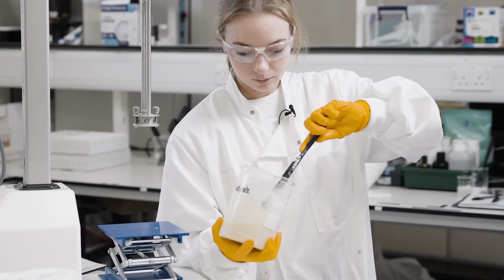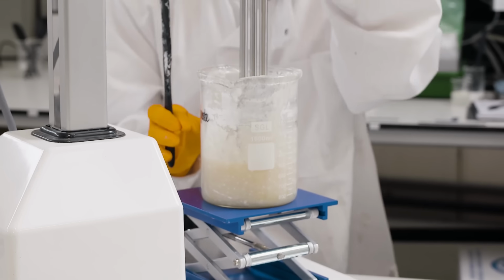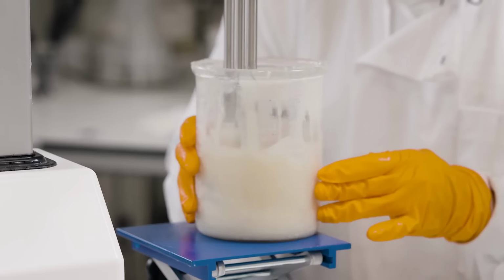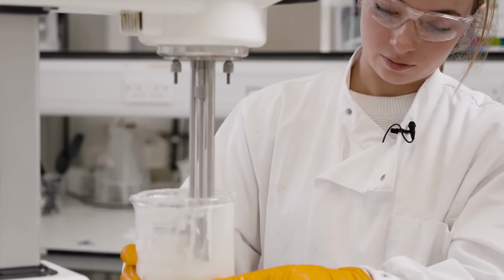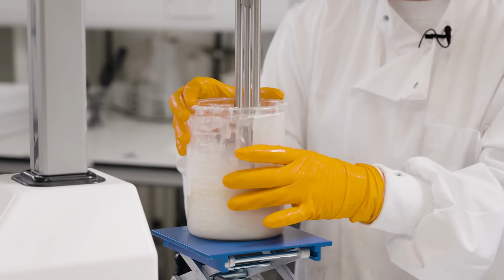The silica generally stays in these clumps in the formulation, but on the Silverson, it sends it right through, smooths it out, and the toothpaste is ready to go so much quicker. The conventional mixing methods, they'll move the lumps around, but there's nothing to physically break them down, and that's where the Silverson comes in. And already that's looking really smooth now.